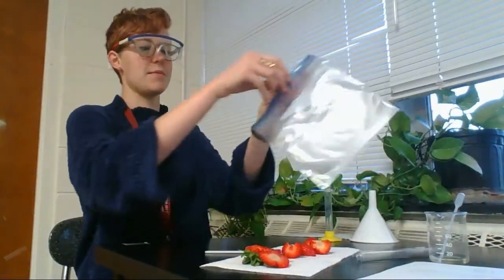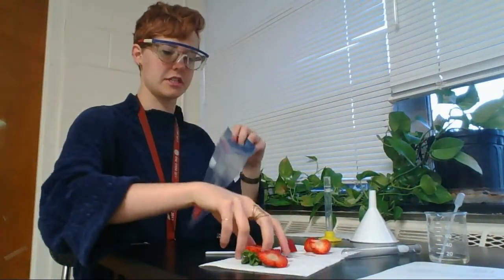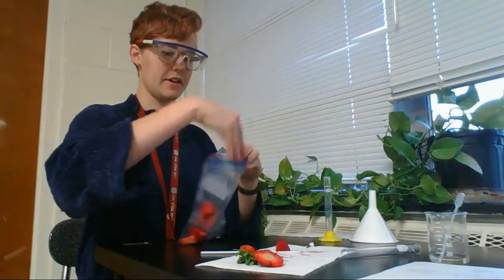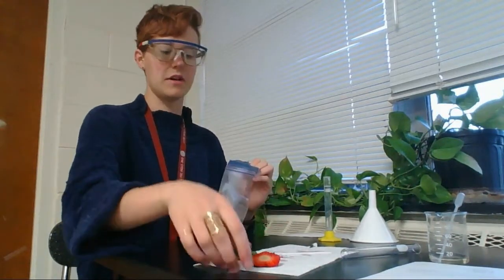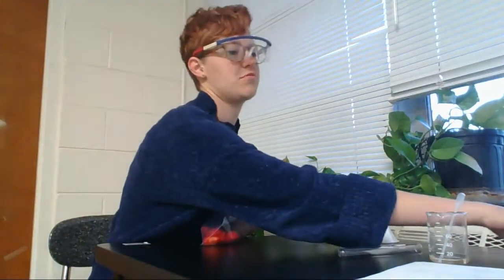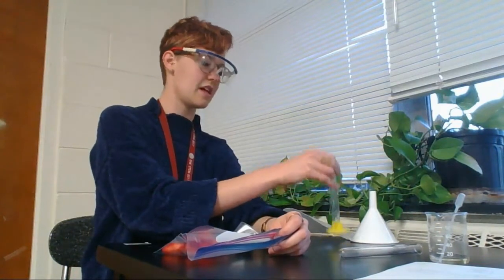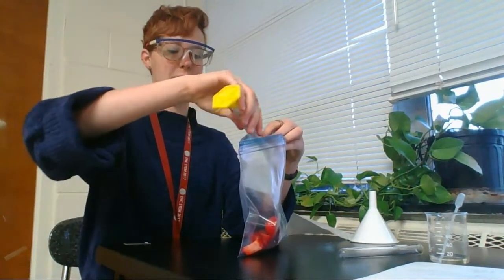Then I'm going to take my Ziploc bag and I'm going to put my strawberry chunks inside. I'm going to leave my two green stems on my paper towel and I'm going to push that plus my plastic knife just over here to the side. Next up, I need to get my extraction buffer. That's that blue solution in this graduated cylinder here. I need to add all 10 milliliters to my bag.